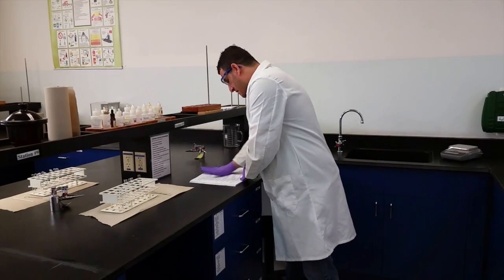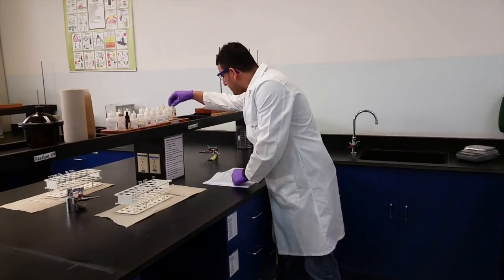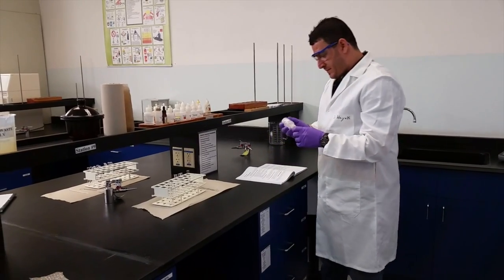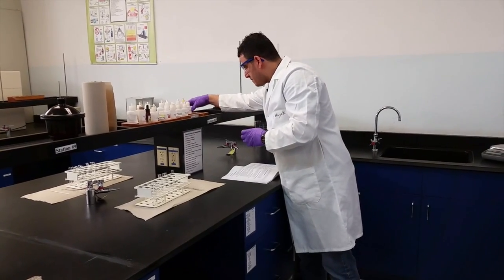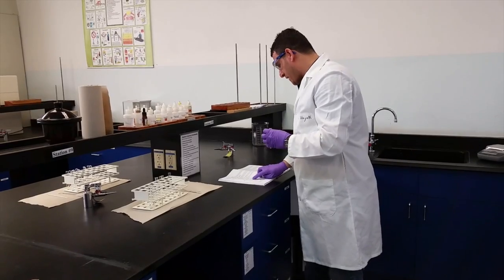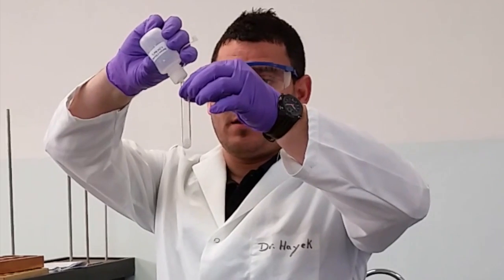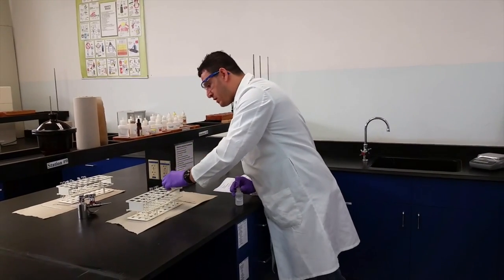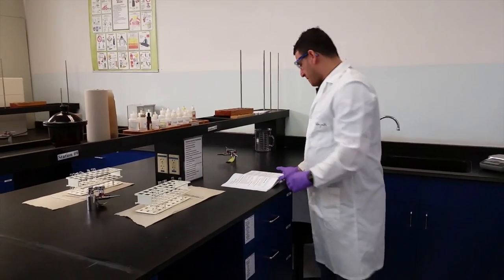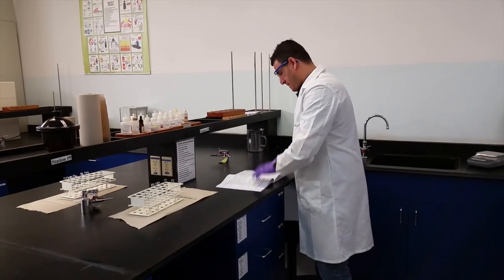For the sulfate test, take five to ten drops of sodium sulfate and add two to five drops of barium chloride. The barium chloride with sodium sulfate produces barium sulfate, which you all know will precipitate according to the solubility rules. As you do all these tests, fill in your observations in the corresponding tables on pages 56 and 57.